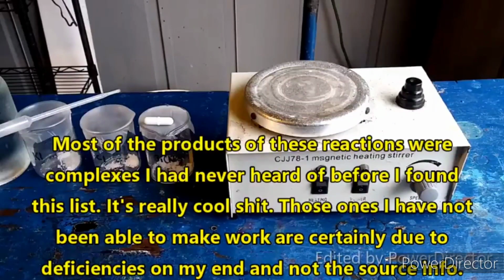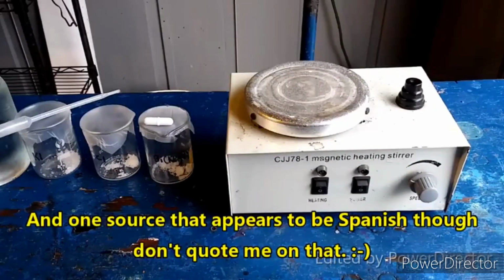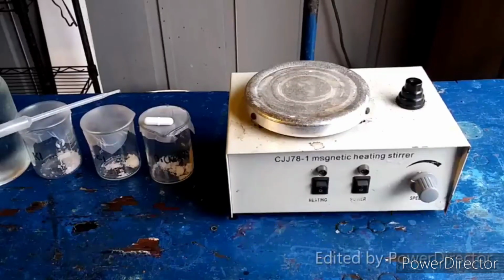Most of the information I can find on the internet about this compound appears to be in Russian, at least the stuff that I saw. The stuff that is written in English is a little... Well, there was a paper that came out in 2005 about a similar compound, and I did see this formula come up all over the place: tricesium nonaiodobismuthate.